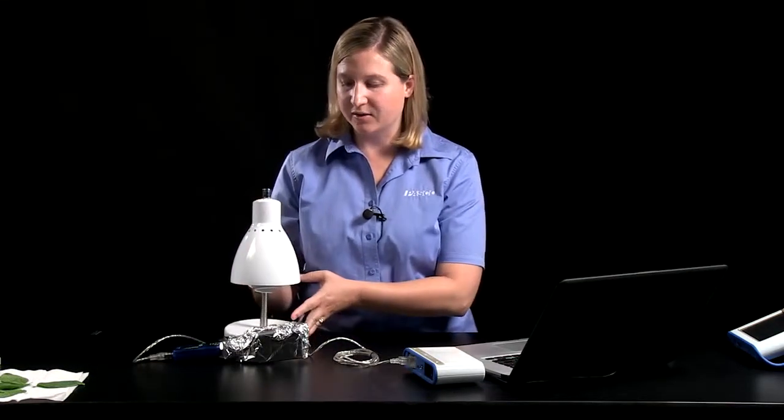So hopefully you've seen from this presentation that providing a lab to your students that gives them direct evidence of what's happening during photosynthesis and respiration can be an easy lab to perform. And one of the reasons I like this lab is not only does it help them understand those chemical equations for respiration and photosynthesis and the idea of carbon dioxide as a reactant or product of those processes, but I also like that this lab lends itself to easy inquiry designed by the students.